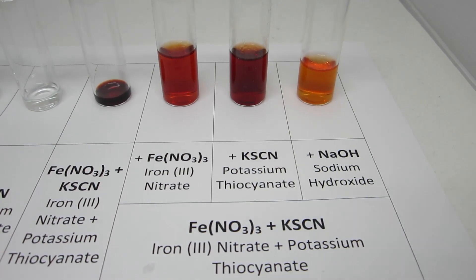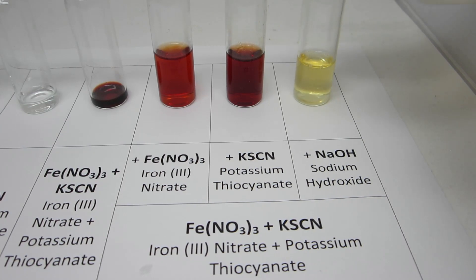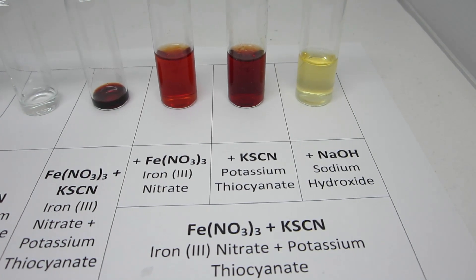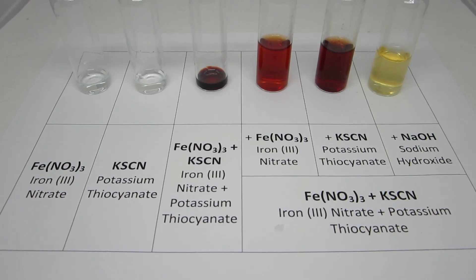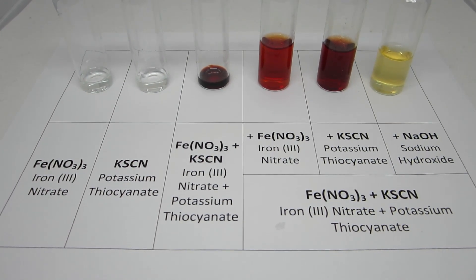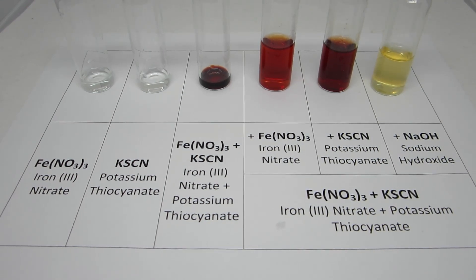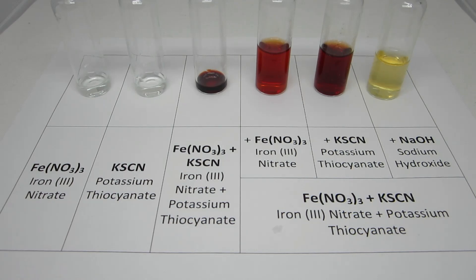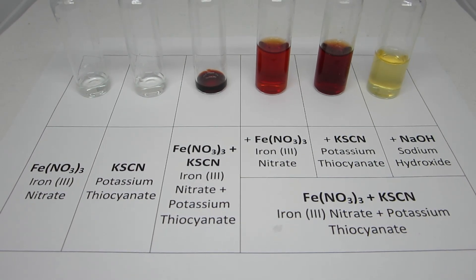Lastly, upon addition of sodium hydroxide, the color dissipates with the formation of the iron tetrahydroxide complex. Overall, the clear and colorless solutions of iron(III) nitrate and potassium thiocyanate react to form an intense red colored solution of iron thiocyanate. With additional iron nitrate or potassium thiocyanate, the reaction shifts to produce more of the intensely colored product. With the addition of sodium hydroxide, the color fades in preference of a side reaction.